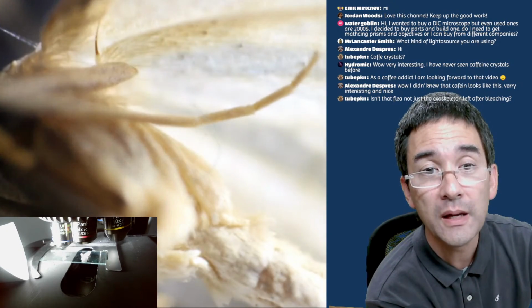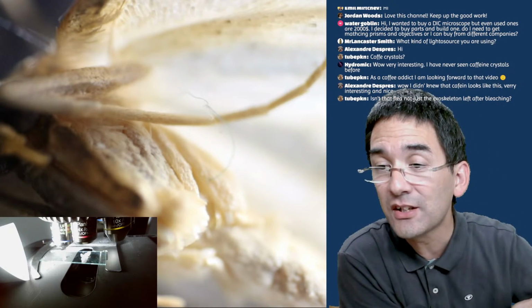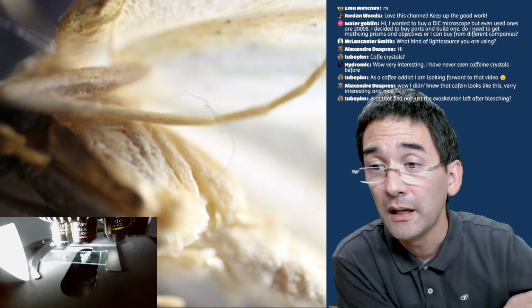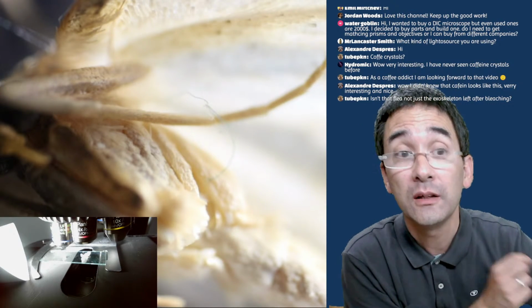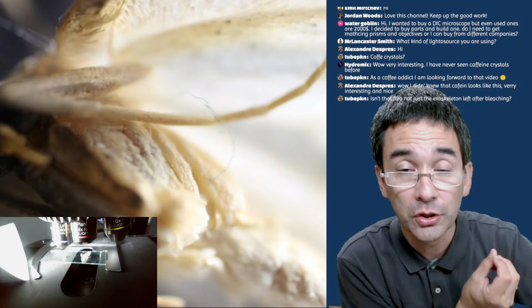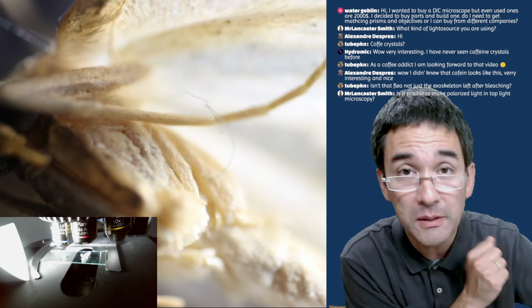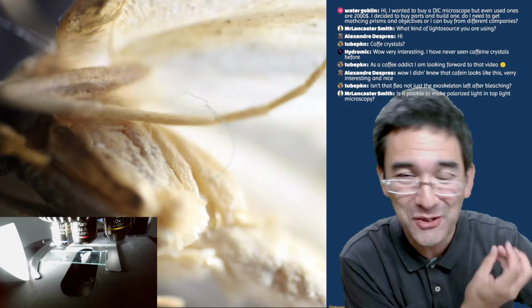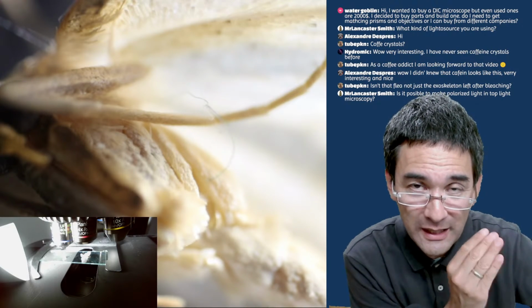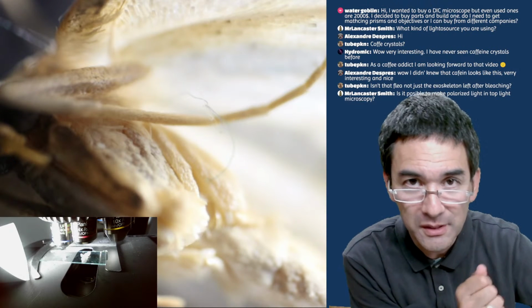So there is now a question here. Isn't that flea just the exoskeleton left after bleaching? No, it's not just the exoskeleton. If you zoom in, you can actually see the muscles also. Sure, there are certain specimens that contain exoskeletons only, maybe, but this one seems to be a pretty complete one. Of course, because it's dry and dehydrated, maybe some of the organs have shrunk. But if you zoom in, you can actually see the so-called striations of the muscles. So there are still muscles present in there.